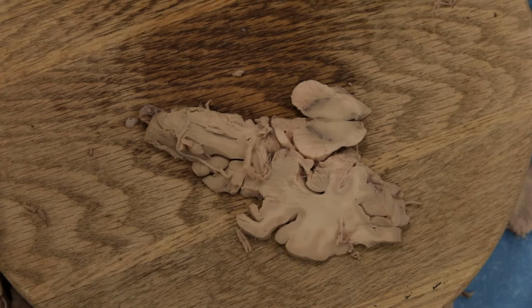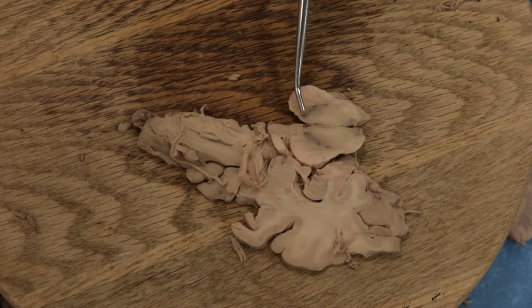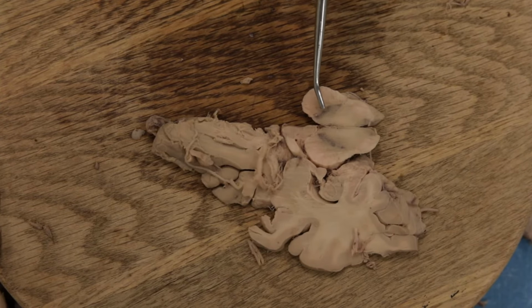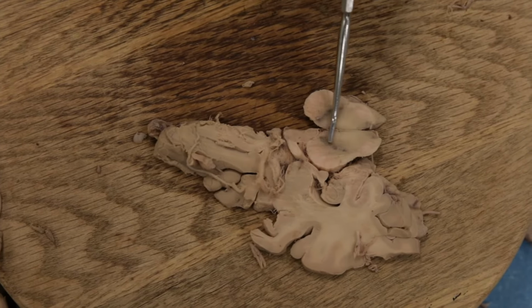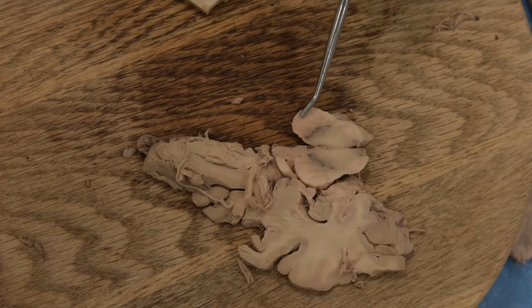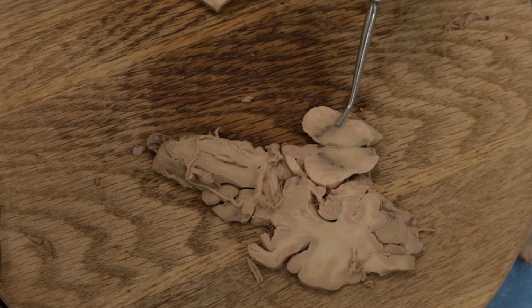Okay. All right, so we're one section lower in the midbrain now, and one thing that should stand out is that we've got a pretty healthy substantia nigra there. But it's pretty clear this individual did not have Parkinson's disease because there are a healthy number of dopamine producing neurons that we can see there. So in this section we can still see the cerebral peduncle. Okay, now the substantia nigra.